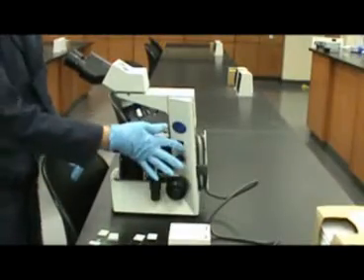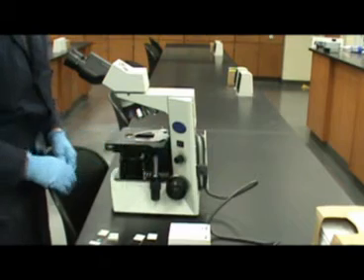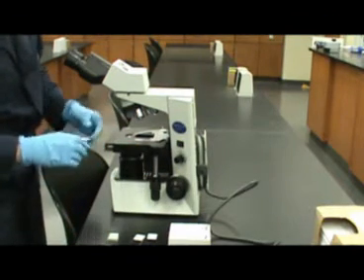After plugging in the microscope, you may turn it on. You should see a light come up through the stage.